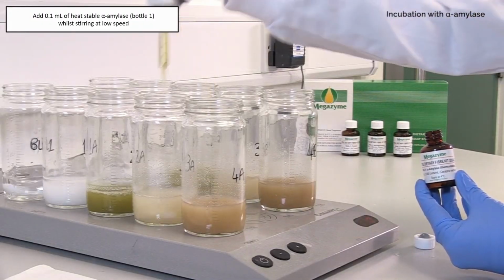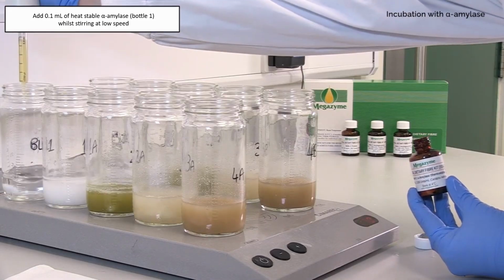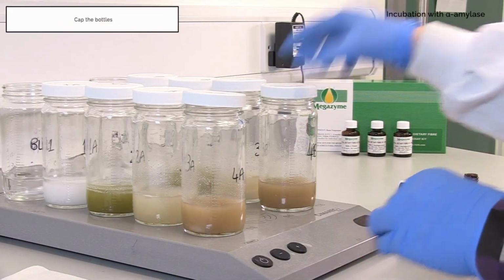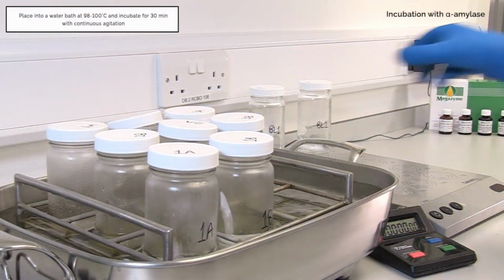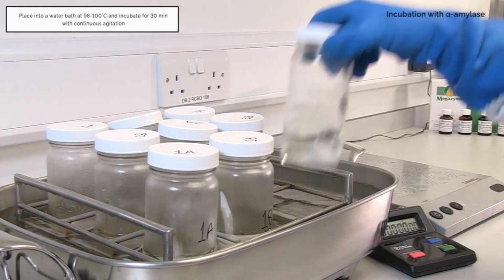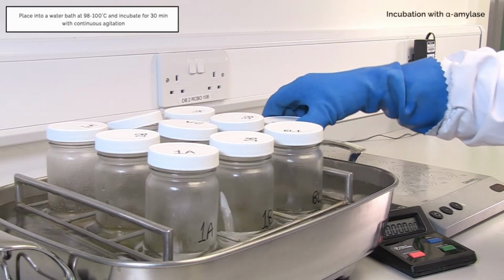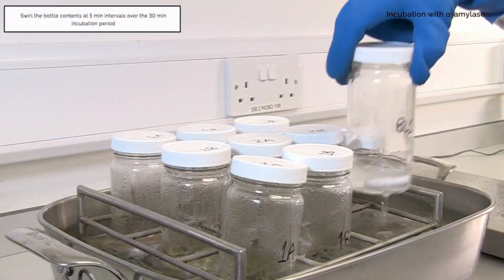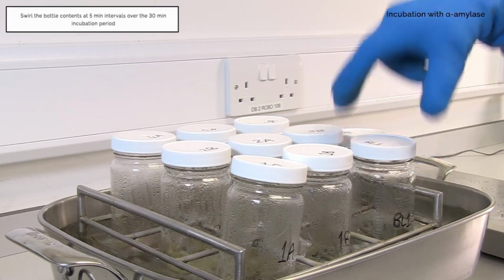Add 0.1 milliliters of heat-stable alpha-amylase, bottle 1, while stirring at low speed. Cap the bottles and place into a water bath at 98 to 100 degrees Celsius and incubate for 30 minutes with continuous agitation. Swirl the bottle contents at 5-minute intervals over the 30-minute incubation period.